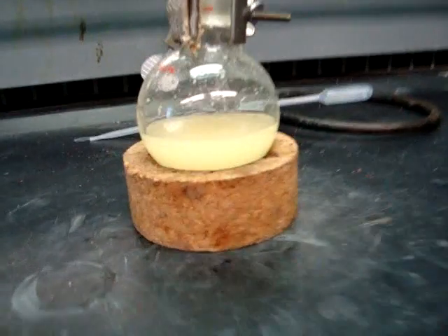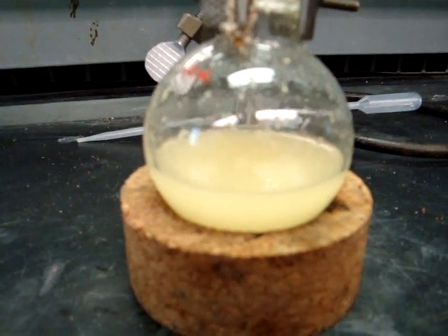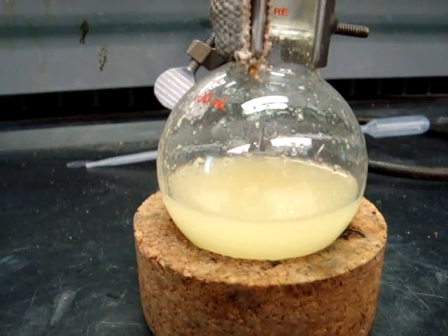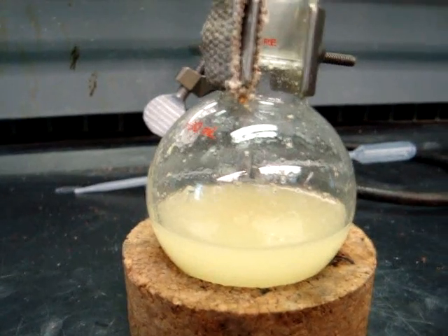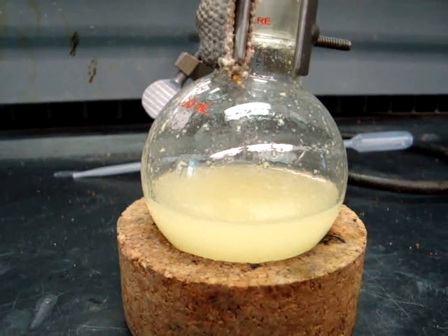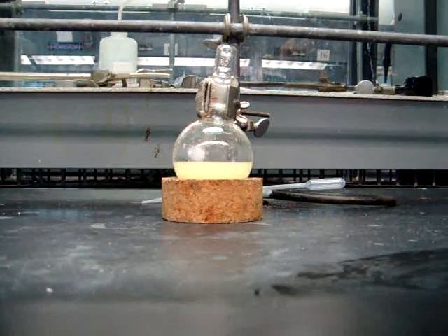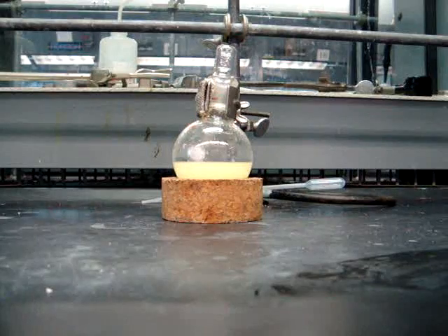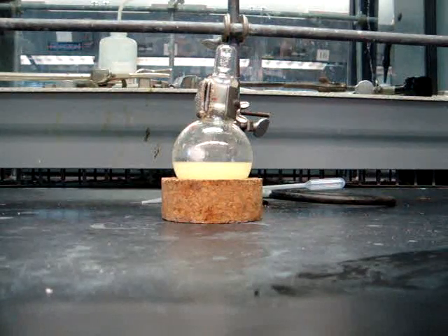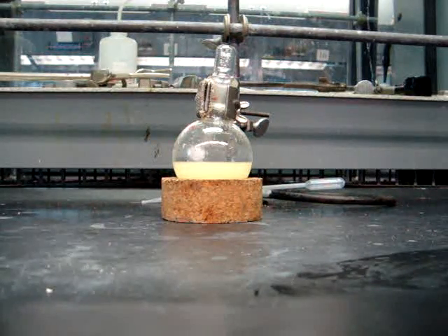If you don't see crystals, make sure you scratch the inside of the flask with a glass rod or spatula. Also, if you still don't see crystals, you can put your round-bottom flask in an ice bath.